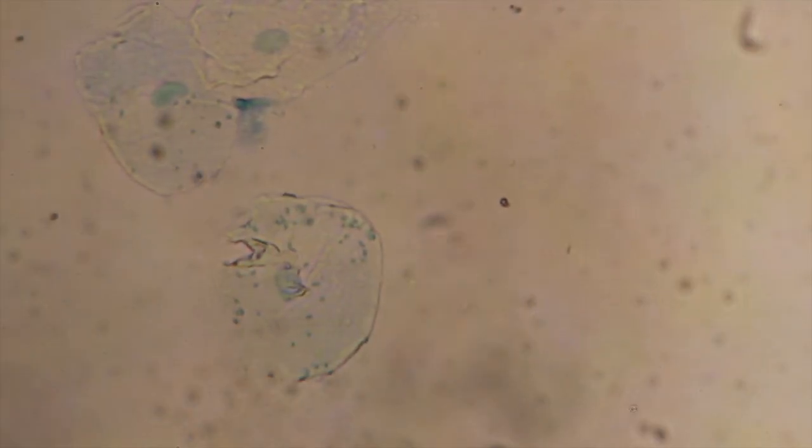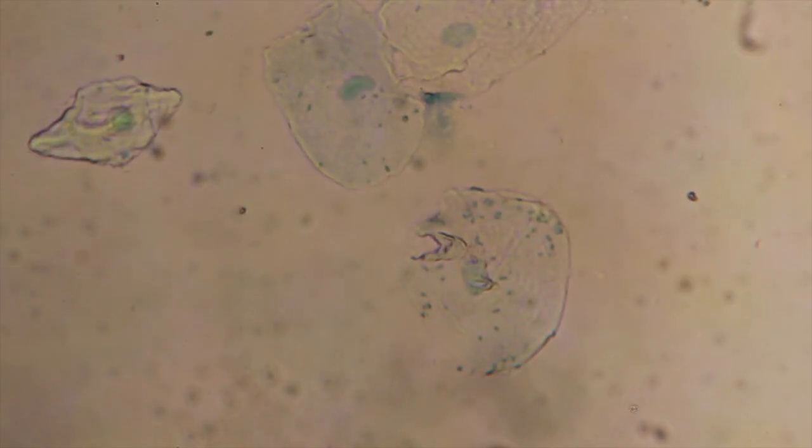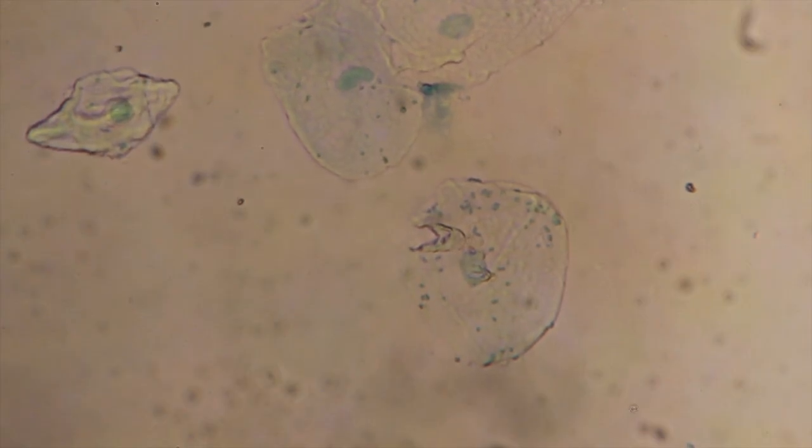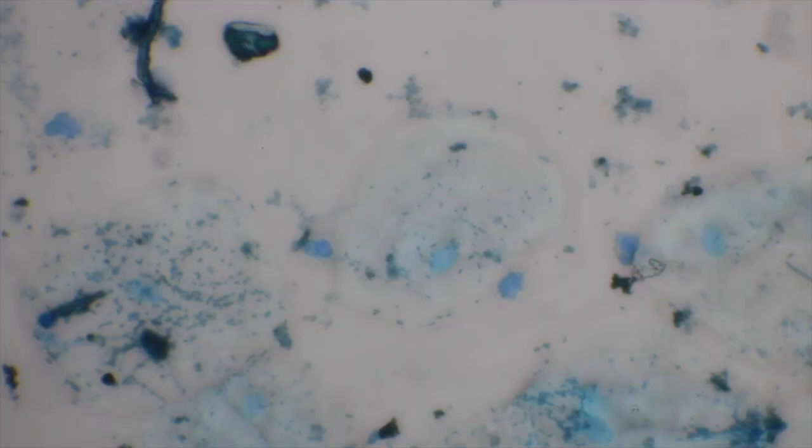Okay. Now if I'm going to go up under oil to look at this, then I need to get that exactly in the center. So there's our cheek cell. It's under our 400x magnification. We're now ready to move to the next step, which is going under oil. Okay, so here's our cheek cell under the 40x objective. I'm going to take it under oil, so I put it halfway between the 40 and the 100x objective. I'm adding a drop of oil to the slide. And then I'm going to wheel in the 100x objective into that oil.